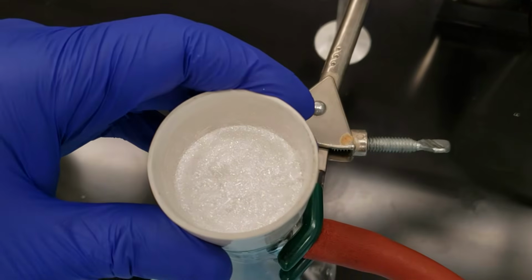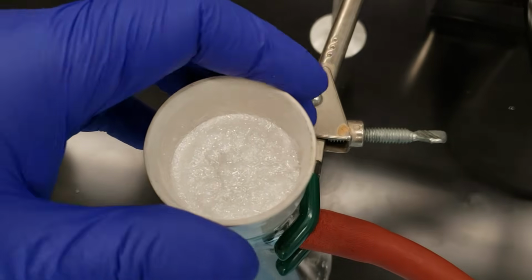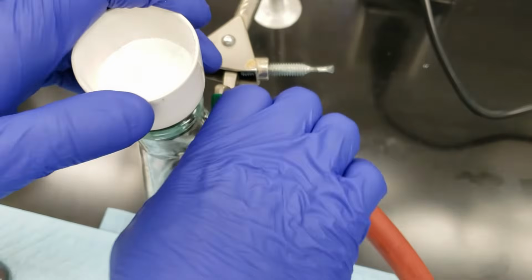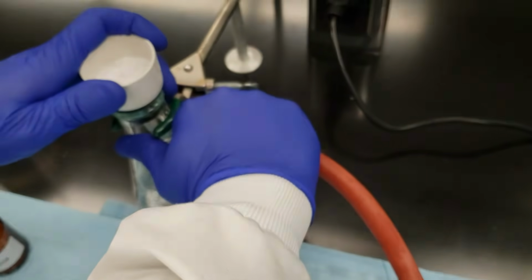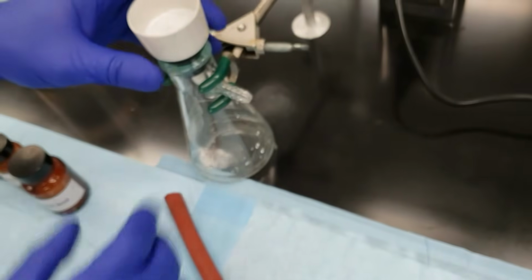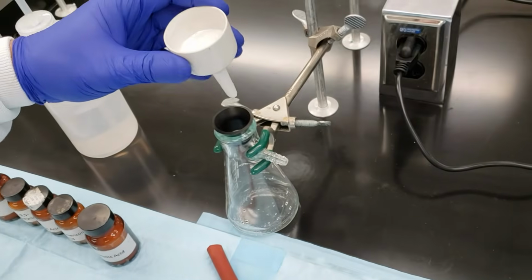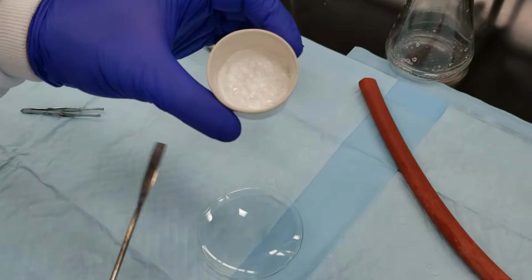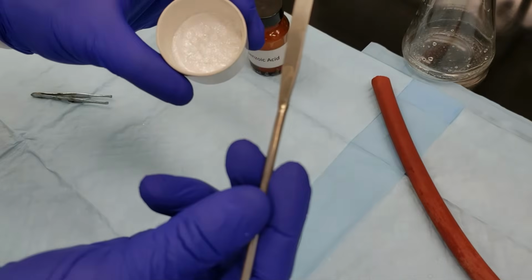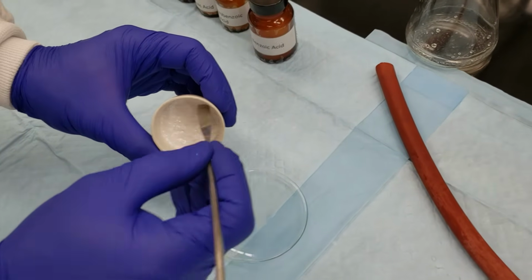All right, so we've been pulling air through our crystals for a couple of minutes to try and get as much water out as we possibly can. First thing that I'll do is break the seal here at the flask. That's going to release my suction. I'll go ahead and turn it off at the valve here. There we go. And now I'll take out my Buechner funnel. So we've got all of our nice crystals here. I'm going to use my spatula to go ahead and scrape them off of the filter paper and onto our watch glass.